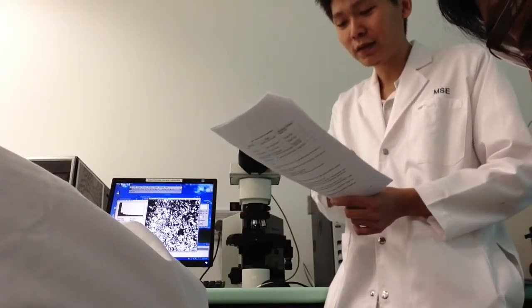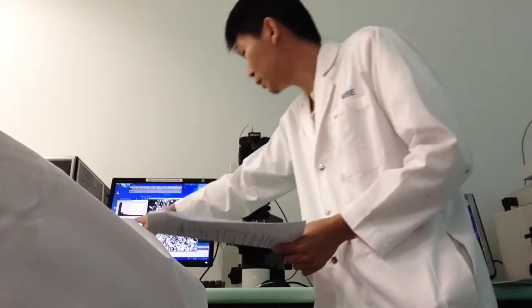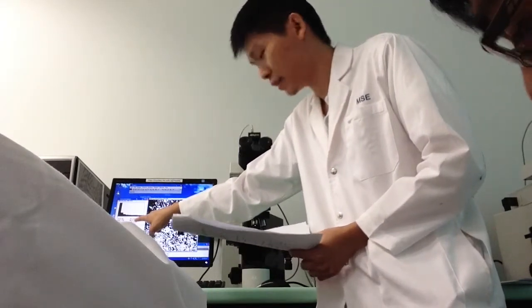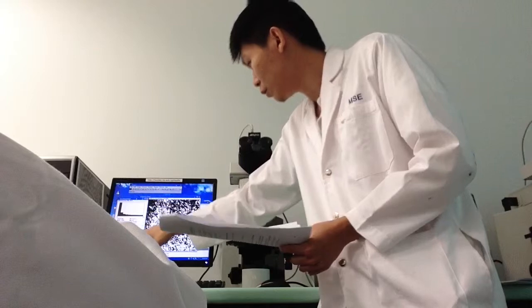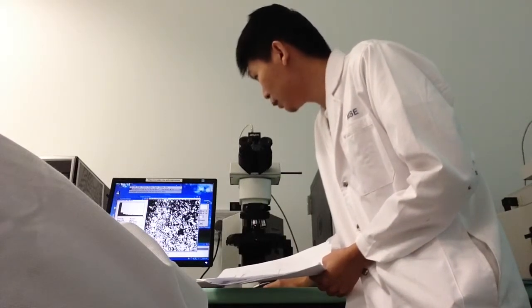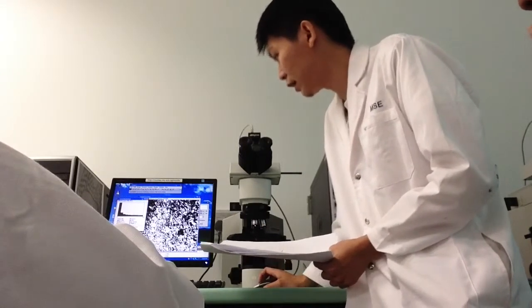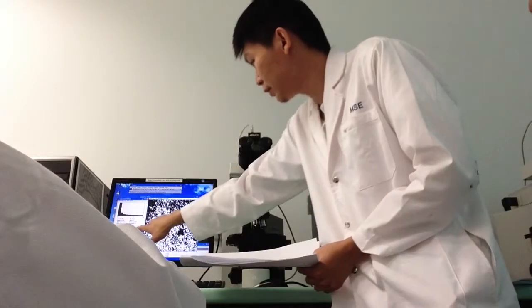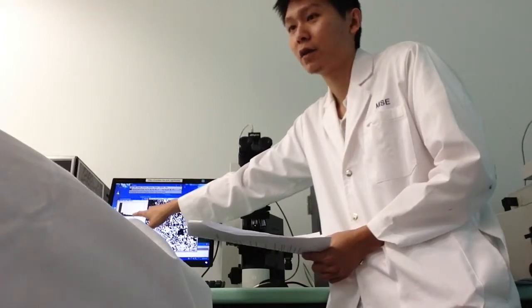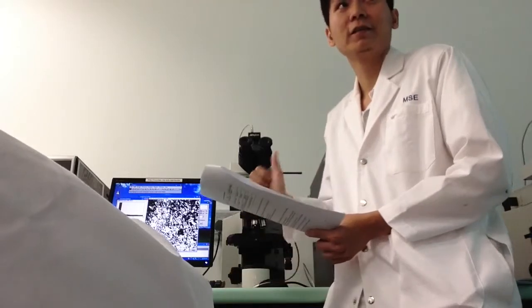So number 4, what is the maximum, minimum and range in grain size? The minimum is only here. So it's 0.915, that is your minimum. What we mean by the maximum is that if you place your cursor under the last bar, you should see the value of 24. This value is the actual value of this last bar. So that is the maximum.